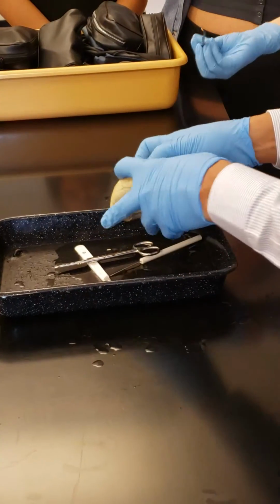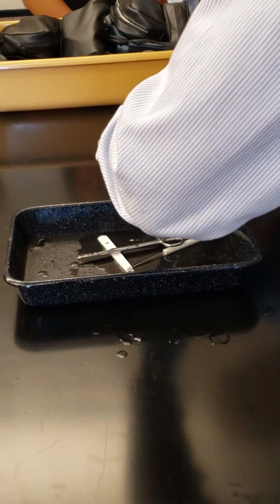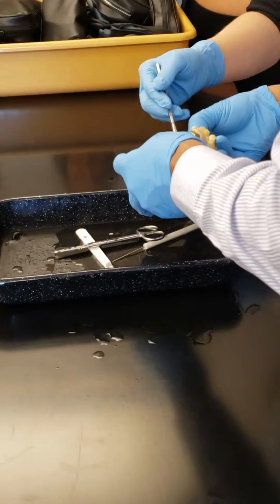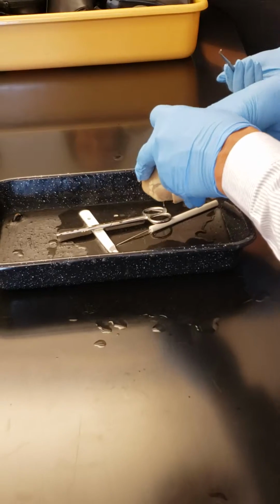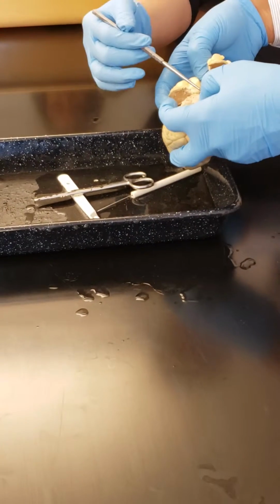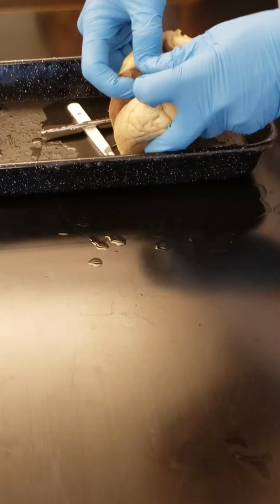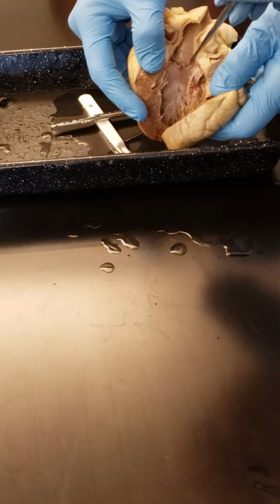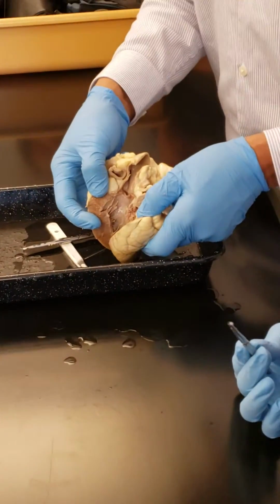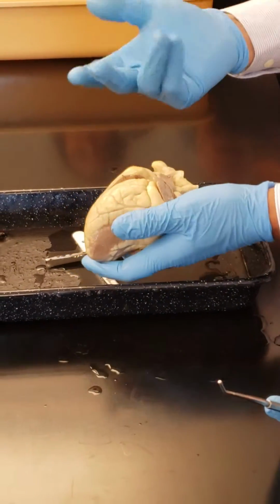Okay. Now you see this? See these pockets here? You see the pockets? And the third one also you can see it is cut here, but you can see a little bit. Yeah, see this side. You see the pockets? Okay, this side. Right? So this is the aortic valve. How do you know it is the aortic valve? It is coming from the ventricle. Right?